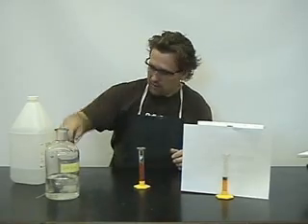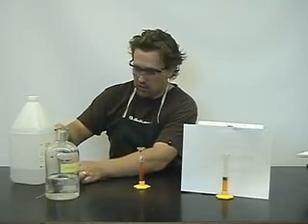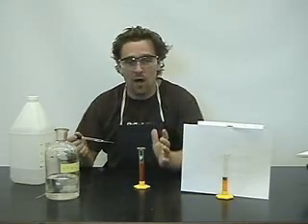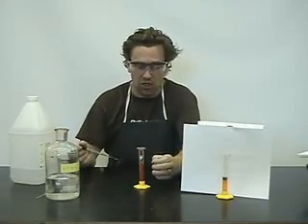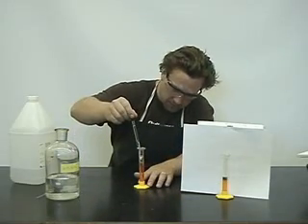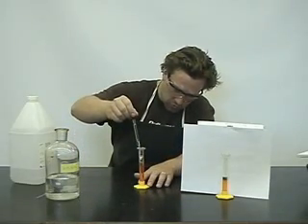Now we're going to add the ethyl alcohol. Now we'll add about a drop or approximately a mil. Now what happens is if we leave this unstirred, our reaction begins and the top layer goes green.